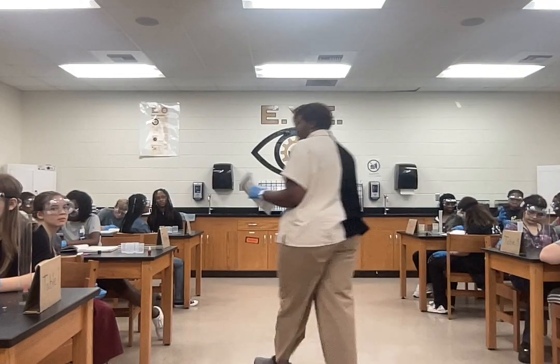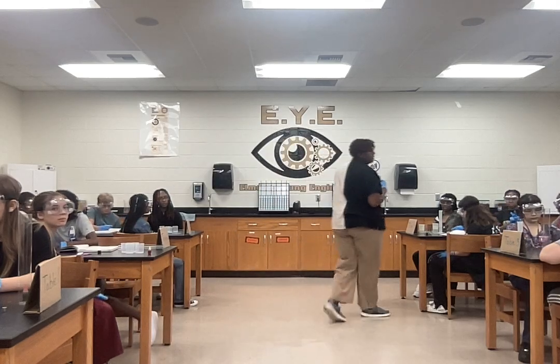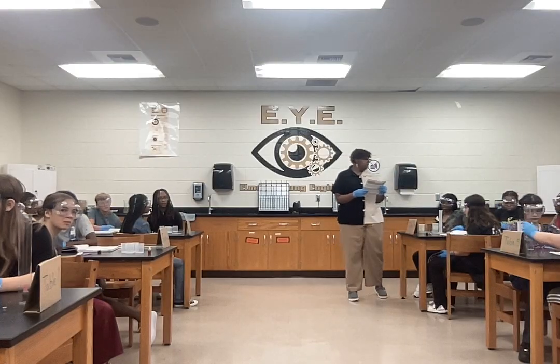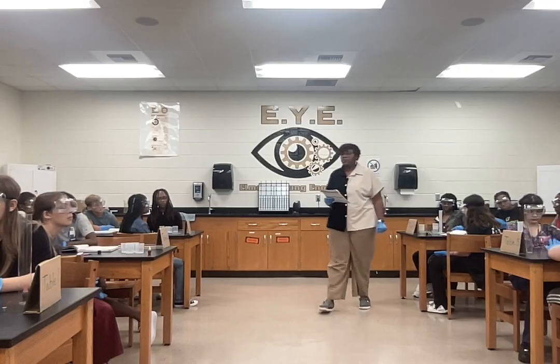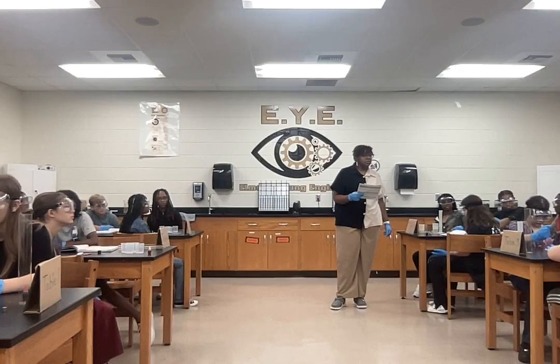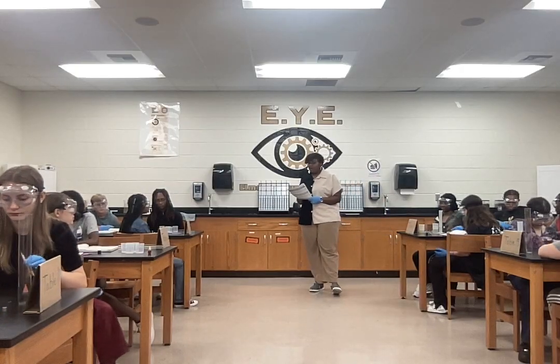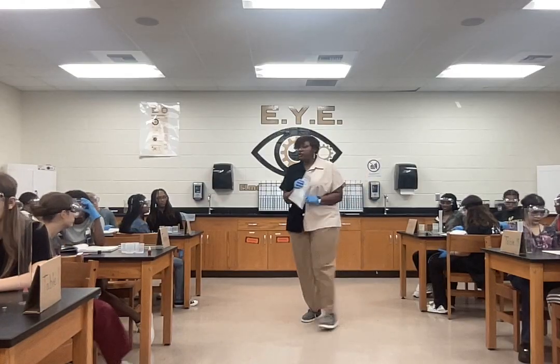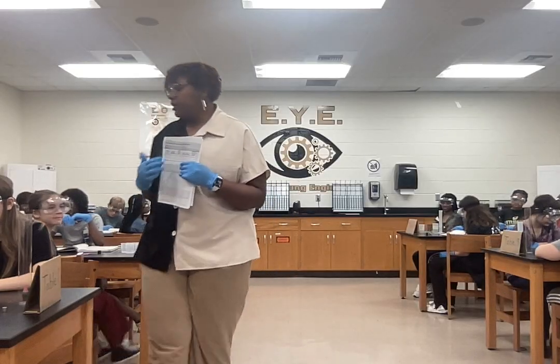Then, right beside that, it says mass of graduated cylinder along with water. Okay? And so for 0 milliliters of water, what do you think our mass will be for that column? Will it stay the same? Will it go up or go down on that second column? It will stay the same. Thank you, Tanner. It will stay the same because we don't have any water in it. So you got 34.86 in those first two columns right here. Okay, because that's a graduated cylinder by itself.